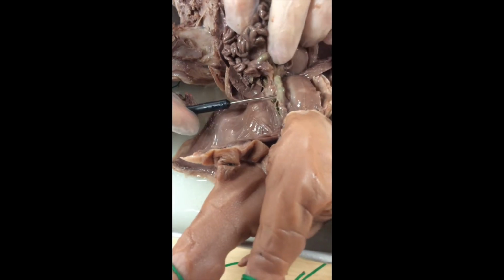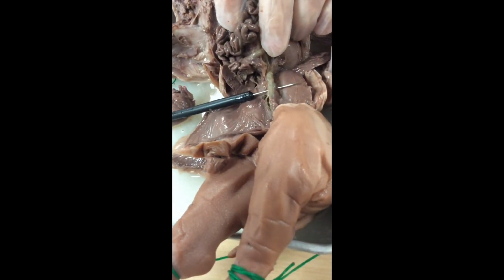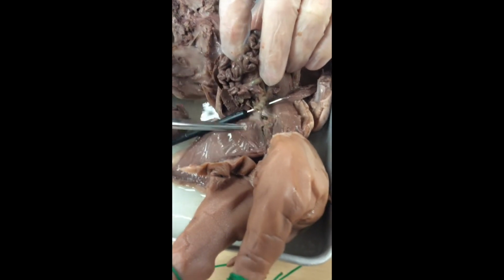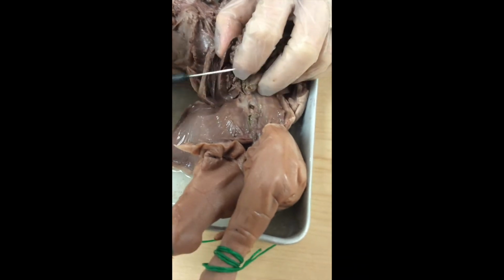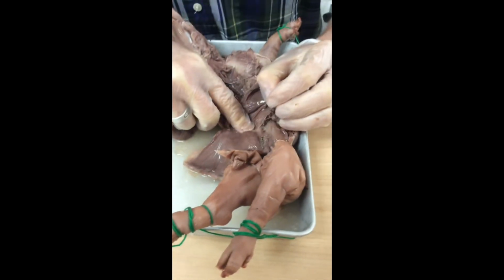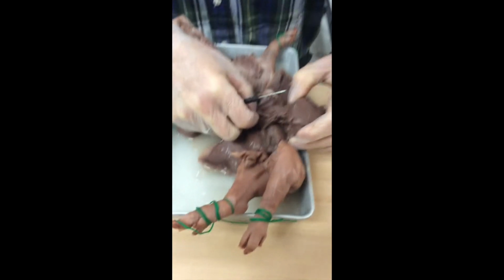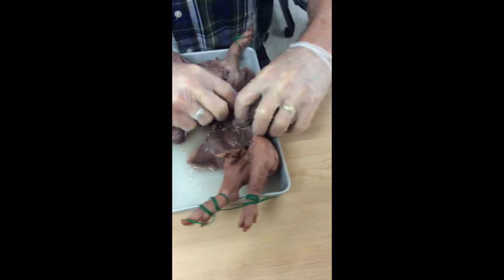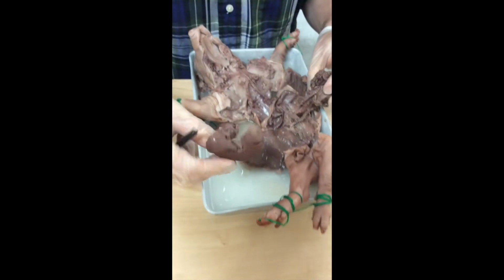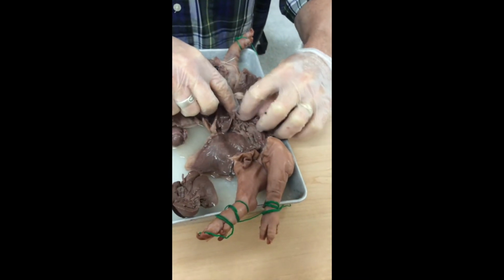Now, what I've got right here, that's the rectum. That's the straight pipe of the digestive tract, the very end of the digestive tract, and that, of course, leads to the anus. I'm going to go ahead and cut that. And now I'm going to do my best to take out the intestine and the liver and the stomach. Okay, I've got the liver out. Liver's out, so I can count the lobes if I choose to do that. You guys will.